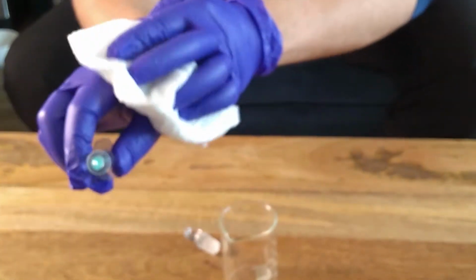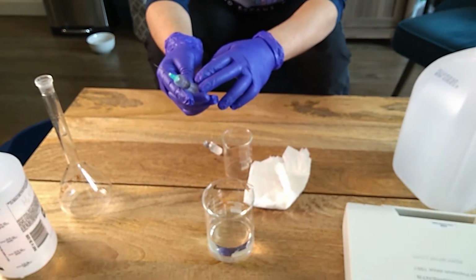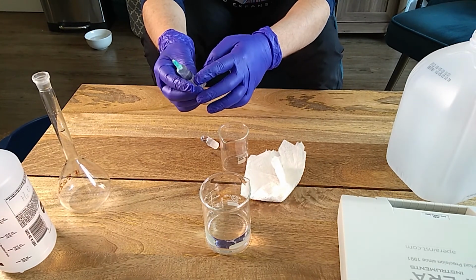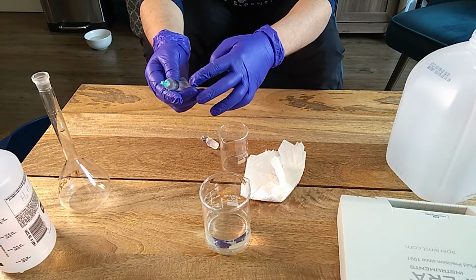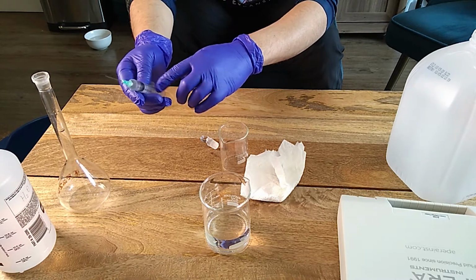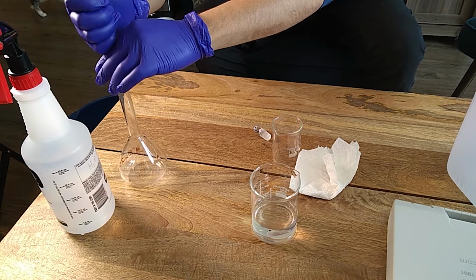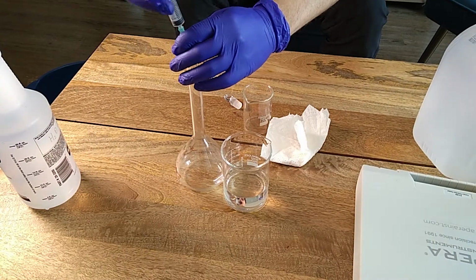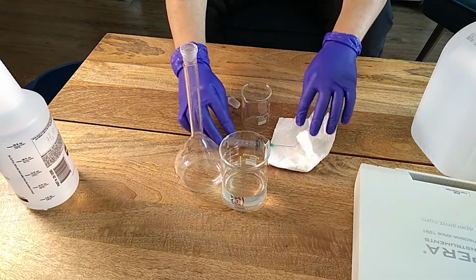The error of these syringes, these plastic syringes, is usually around 5%. So it's not a big error here. It is lower as you go to the larger measurements. When you go to the bigger amounts in the syringe, the error becomes smaller. So now I will just pour this into the flask. So you just lower the stopper till everything is out, and then you're done transferring the volume.